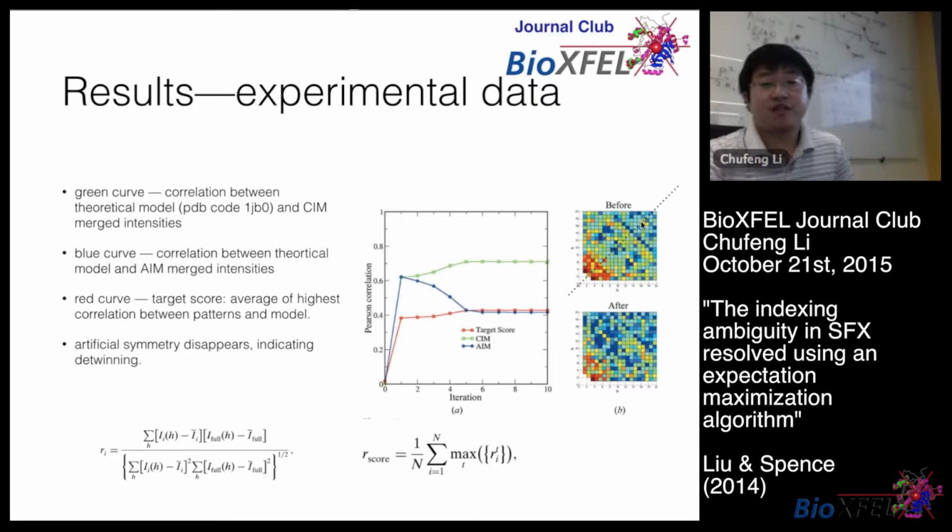So you can see that after several iterations, like after 10 iterations, the artificial symmetry showing the pattern, you can see this is the mirror I drew, because as we mentioned, the indexing ambiguity is about HKL and KH minus L. So this pattern is cutting through the L equals 0 plane. So the symmetry is about this dotted line, right? And this is artificial before detwinning. After several iterations, you can see that the artificial symmetry disappears. So that indicates the success of this EM algorithm implementation in this problem.